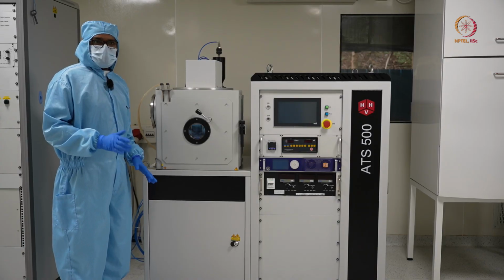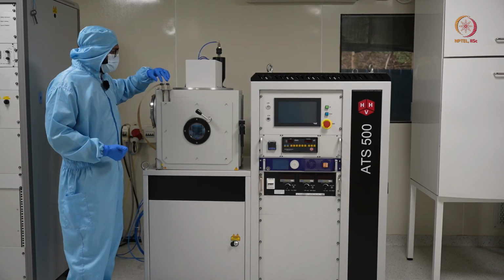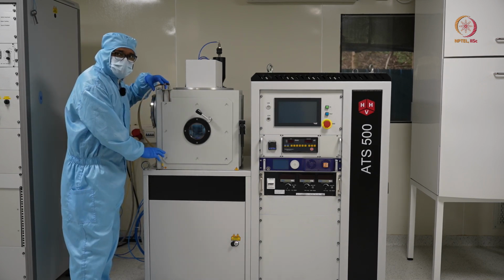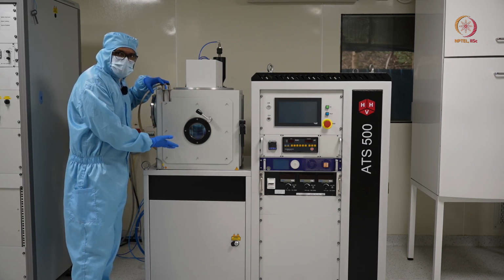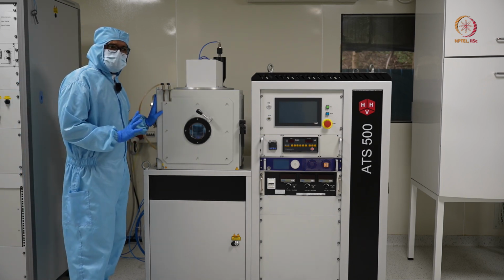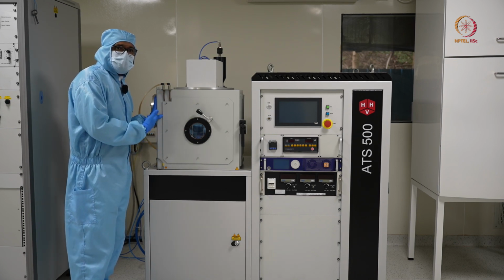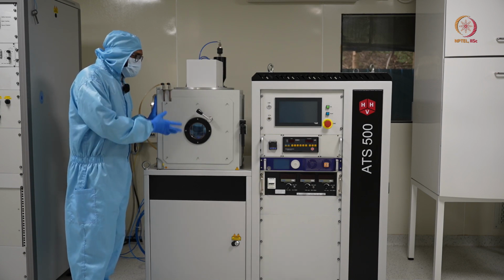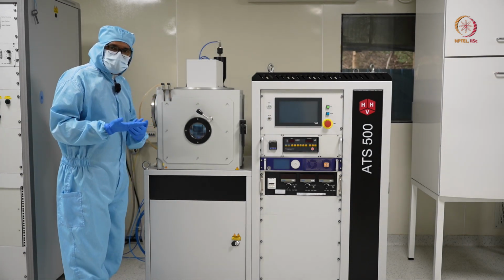Now that I have turned on the main supply and also the supply to the chiller unit, you can see there is one inlet and outlet which is connected to the water jacket around this chamber. This is the chamber where the vacuum will be created and a plasma will be created later on once the vacuum has been reached. It is obvious that when the plasma is created, there will be some increase in the temperature. Also, there is a heater unit attached to this in case you want to do the sputtering at higher temperatures.